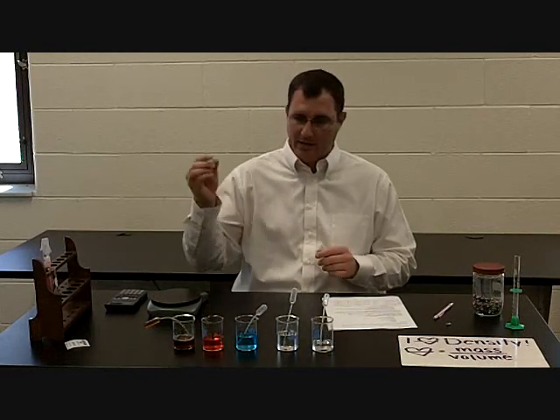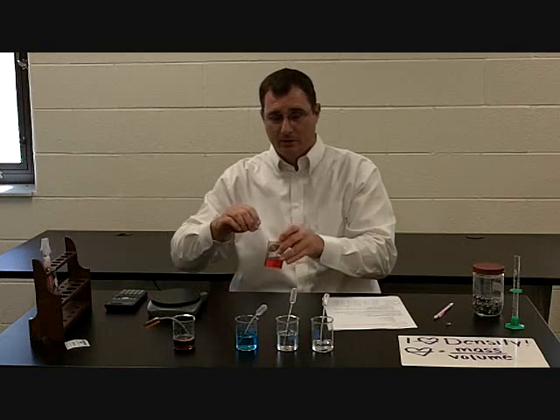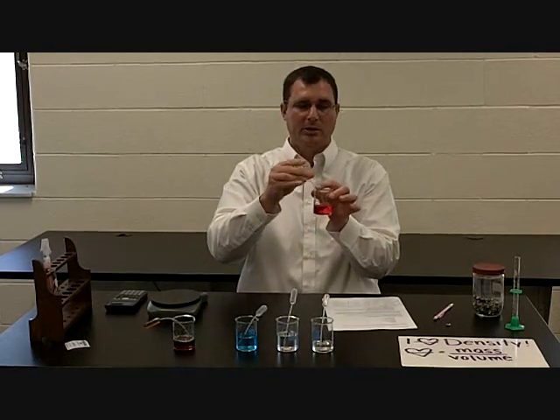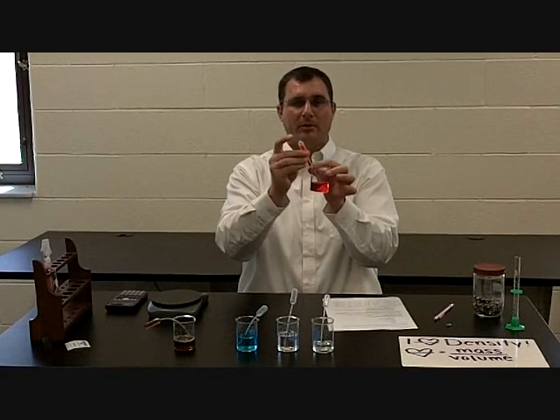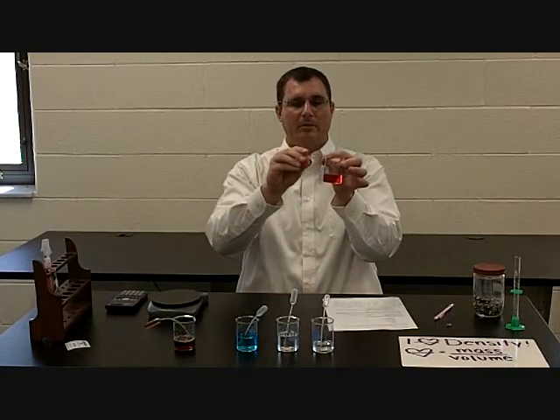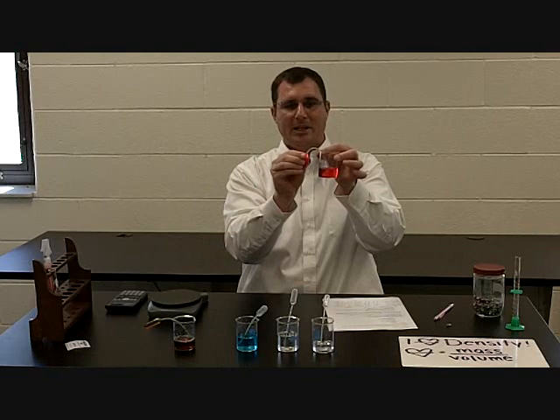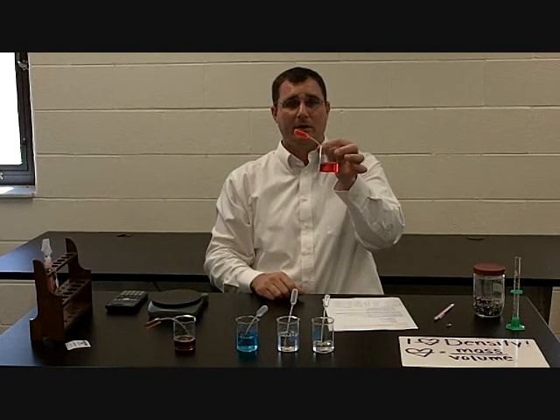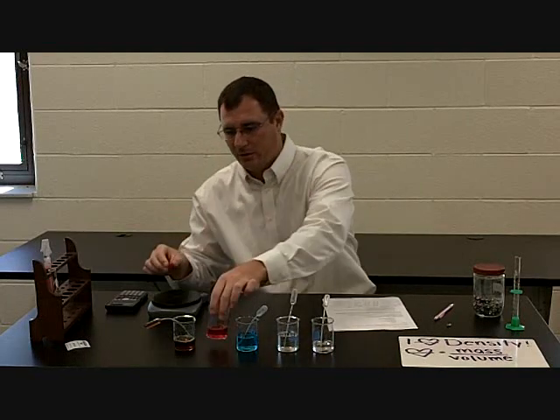Once you do that, we're going to fill a pipette completely. A little trick to filling a pipette: you're going to take one squeeze, and it only gets maybe two-thirds of the way up. Once you do that, bend it over so the air is up, squeeze out the air, and now it will fill completely.